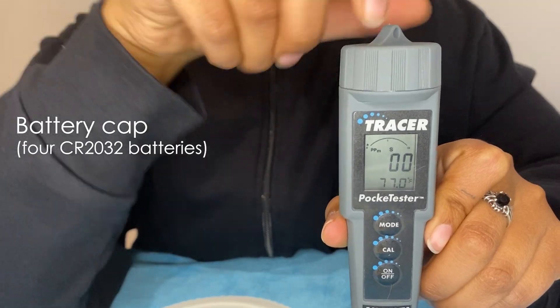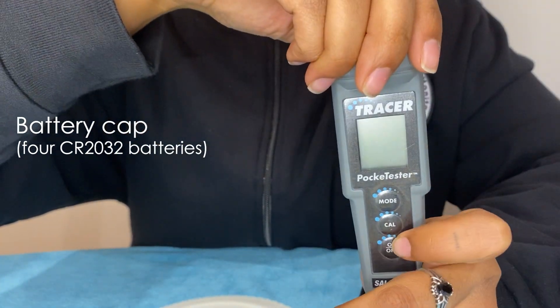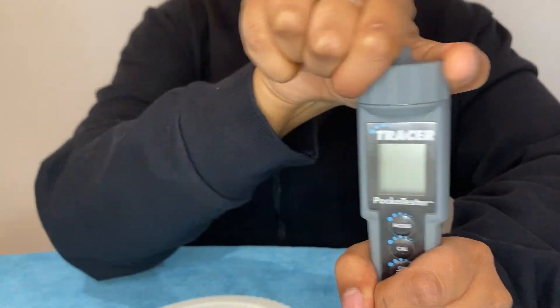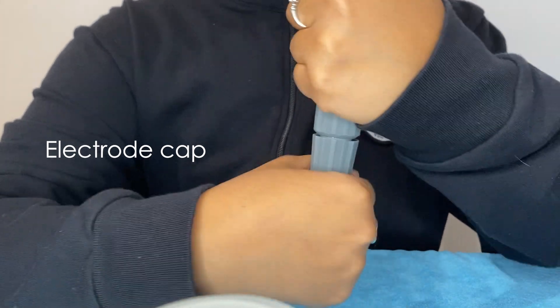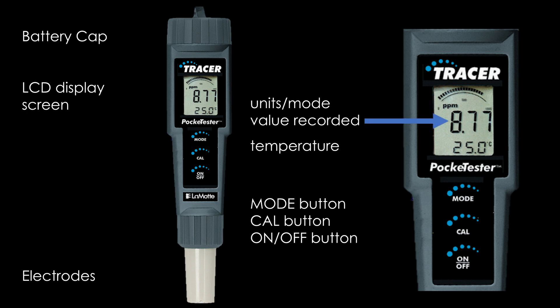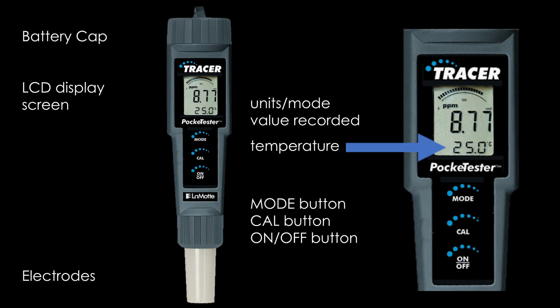To get acquainted with your meter, we will review its parts. First is the battery cap that contains the meter's CR2032 batteries, the optional lanyard string attachment, the meter's electrode cap, and the meter's screen and buttons. The LCD display screen shows the units or mode that you are currently in, the value recorded for that unit of measurement, and the temperature of that substance at the bottom of the screen.